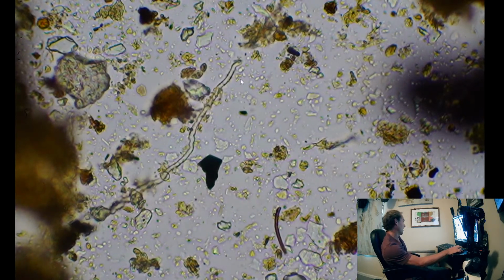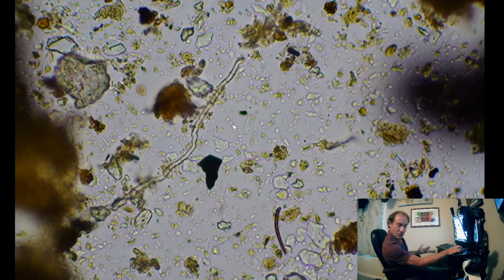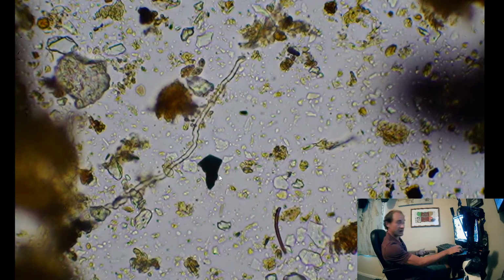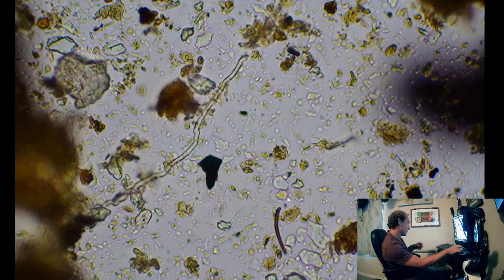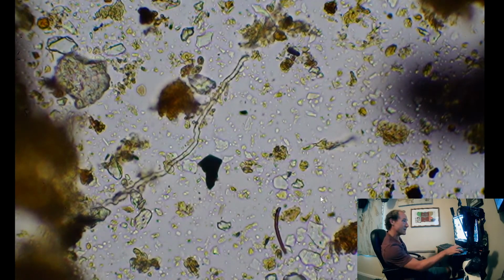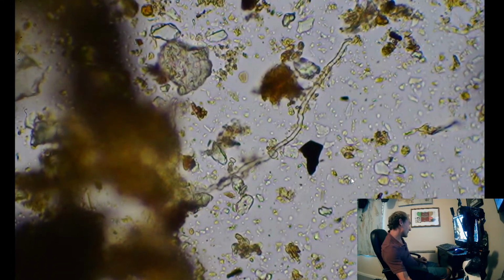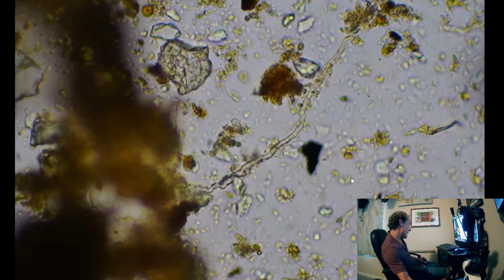It's just started growing. But most likely, it's a saprophytic fungi, most commonly found breaking down organic matter in your compost. It's that white fuzzy stuff that grows in your compost bin if you don't take it out too often.